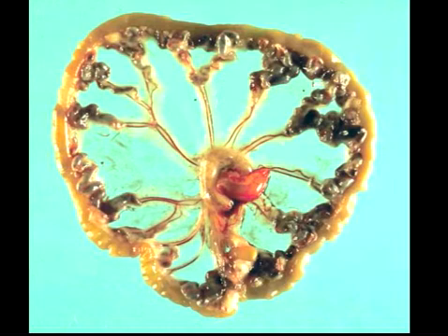Morphologic diagnosis. Well, let's start with naming the disease, because that's the easy part. This is polyarteritis nodosa. Some people call it periarteritis nodosa, and that's fine too. Now, morphologic diagnosis is something you sort of have to noodle through here. And the one that I've carried around with me for 25 years, and I'm very happy if you would use that one as well, give it to you absolutely free of charge, is a multifocal coalescing, necrotizing, and proliferative mesenteric arteritis. Okay, so the location is mesenteric arteritis.